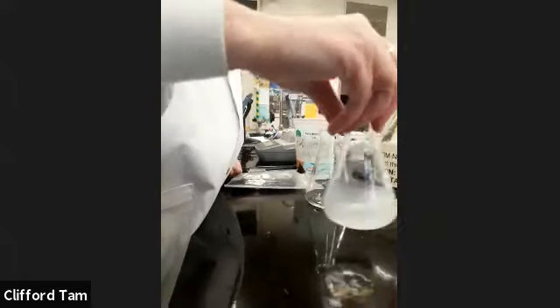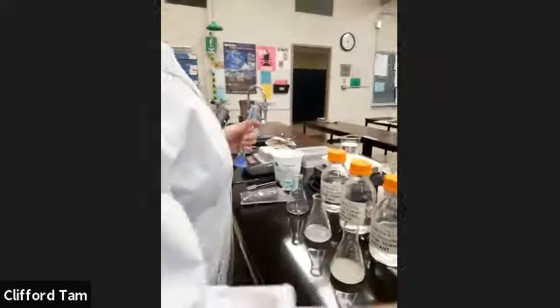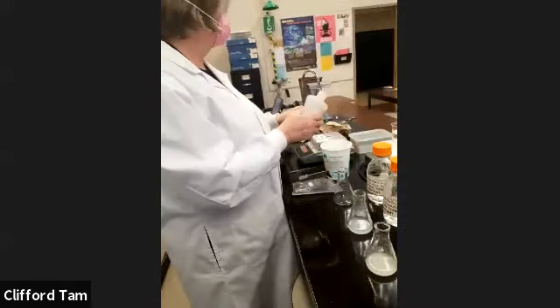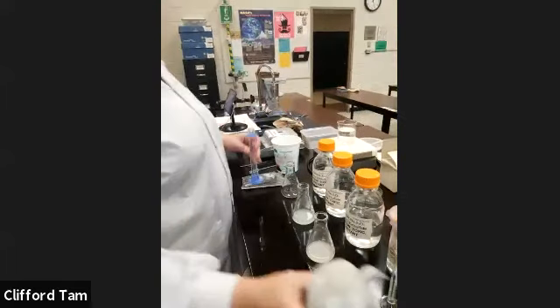34 seconds. Excellent. So was that faster? Is it faster? Less time? I guess so. I guess it means faster. Guys, we can clearly see that it was indeed faster simply because we used less time and therefore made the rate bigger. Okay? Yeah, Rip is right.